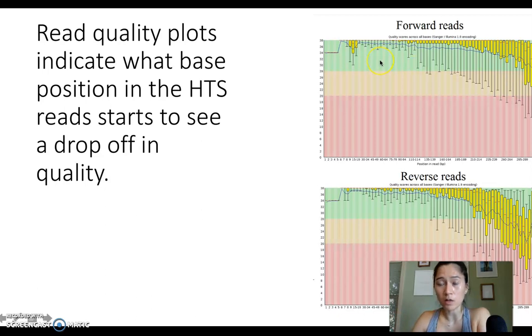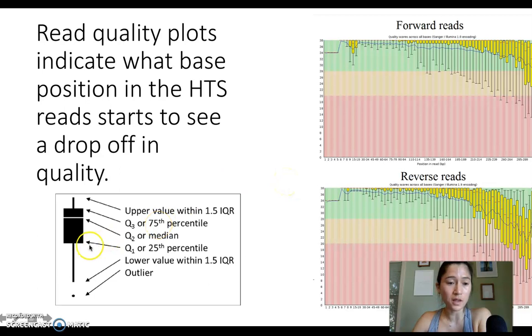What I like about these plots is they're color-coded for us in terms of sequencing reads that are really good. Really high quality is in green, the okay quality is in yellow, and then the really bad is in red, which is below 20. And 20 is the cutoff that I use in our lab this week. These particular plots are box plots. If you remember a box plot, the bottom of the box indicates the first quartile, so above the bottom of the box is 75% of our data.